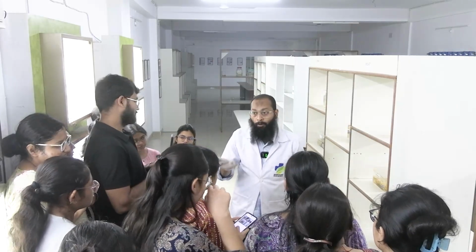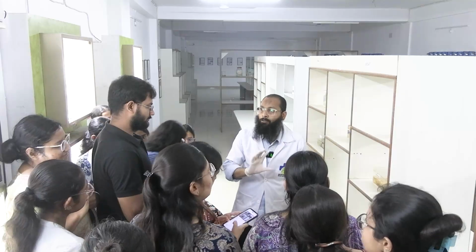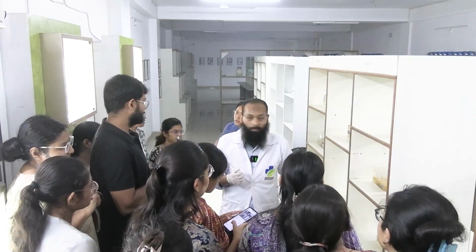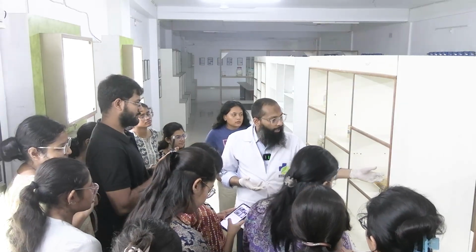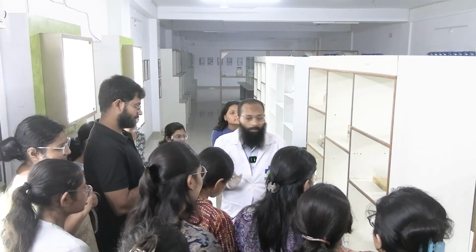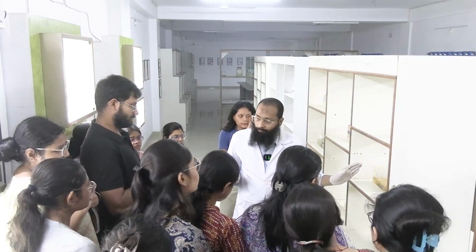Okay, no, don't go for carcinoma directly. Showing presence of a mass, you can say. Okay, so there is a mass. Now you can describe size of the mass, approximate, not exact. You can describe the color.